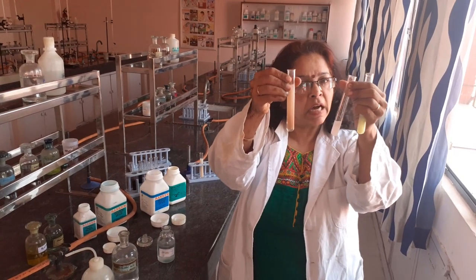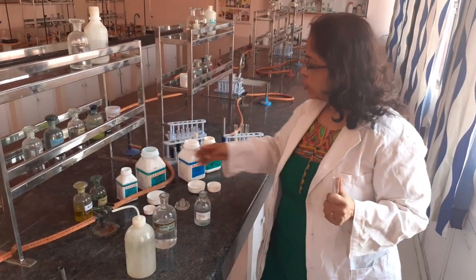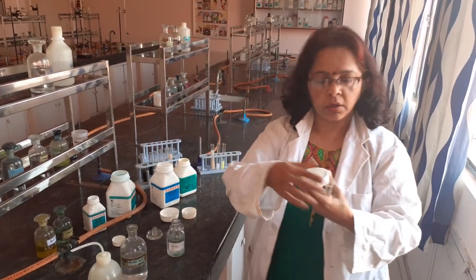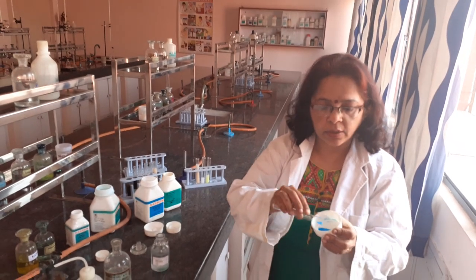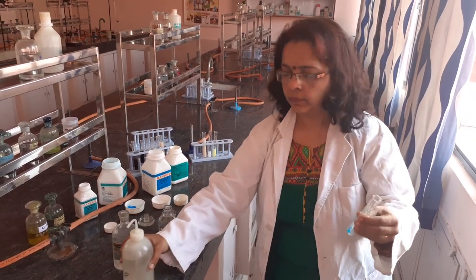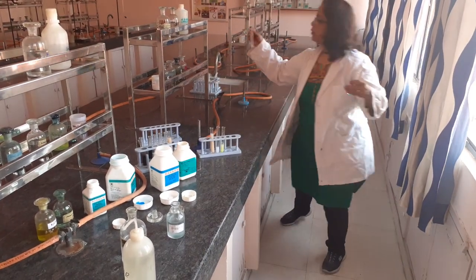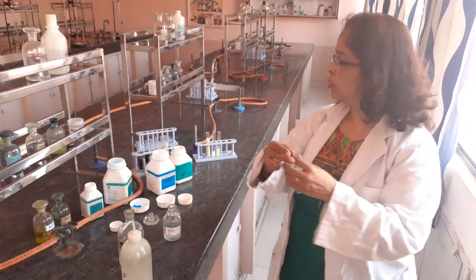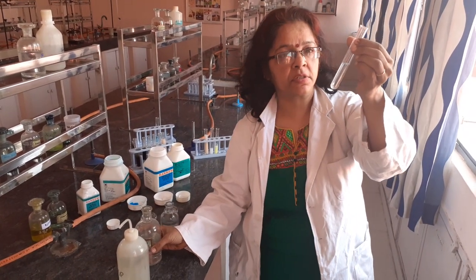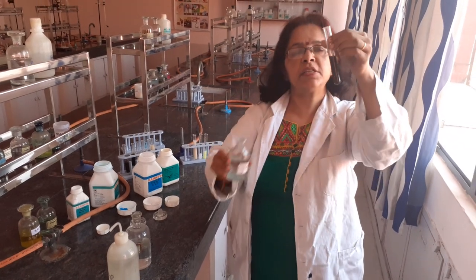This was your Manganese with the buff coloured precipitate. So this was your Group 4 cations. Now, in case you are given a copper salt — normally copper salts are not given — in Group 2 in CBSE you have a copper salt. Copper salt looks like this: deep blue in colour. Make the OS with water. To the OS, Group 1 would be tested first — add dilute HCl. There is no precipitate, which shows Group 1 is absent, that is, lead is absent. To this, instead of adding H2S, you can add sodium sulfide and you would get a black precipitate of copper sulfide.